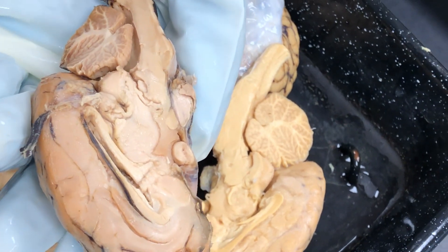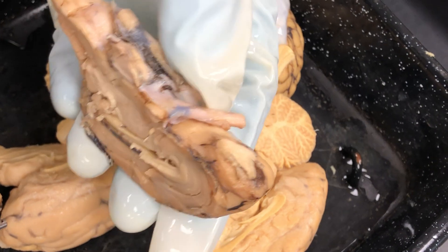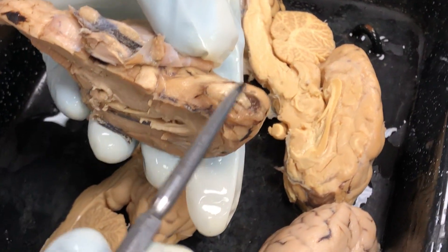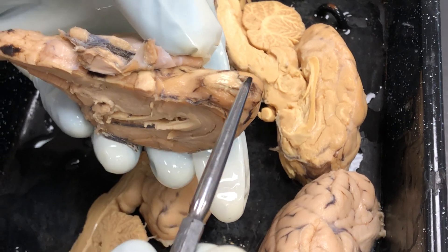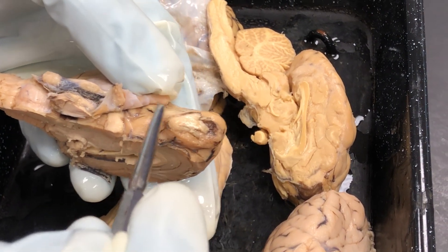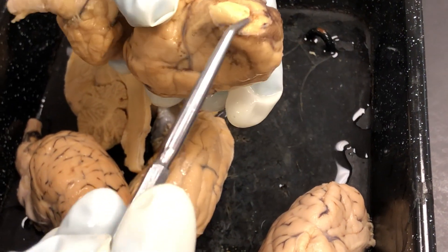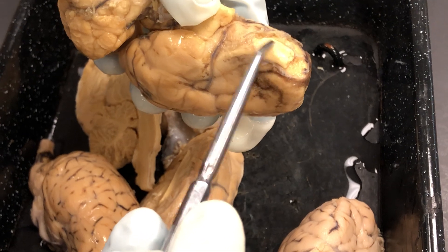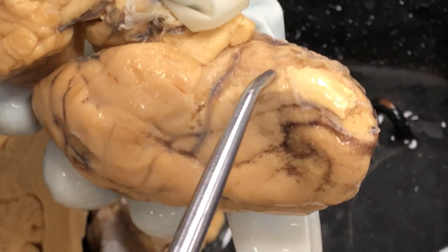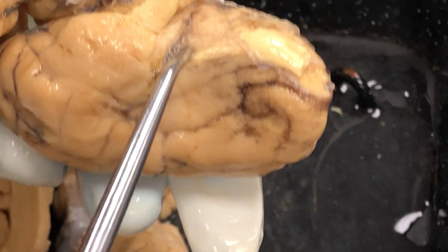We also need to locate the olfactory bulb and olfactory tract. The olfactory bulb is this part right here on the very ventral anterior aspect of the brain. The tract is the white matter that leads away from it. This one is a little torn, but that's the olfactory bulb — the part that bulges out. The white matter tract that leads back from it towards the brain is the olfactory tract.